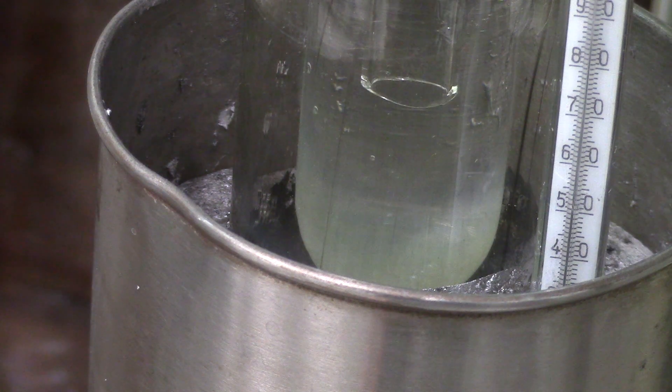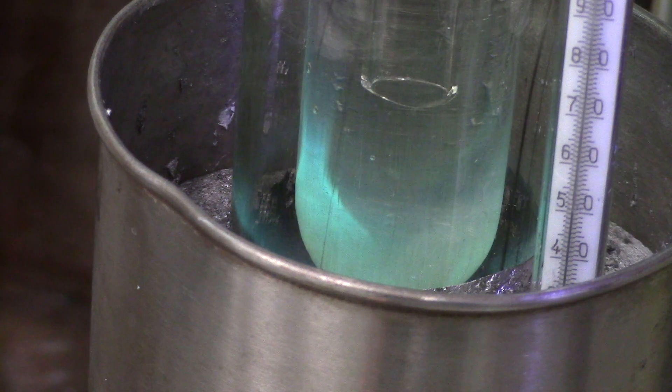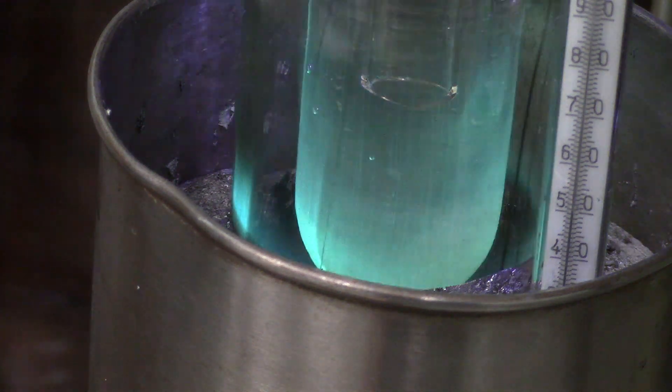Now I propose you to take a look at small time-lapse of crystallization process. Yup, my stuff has a nice blue fluorescence.